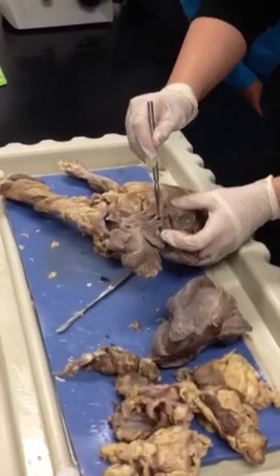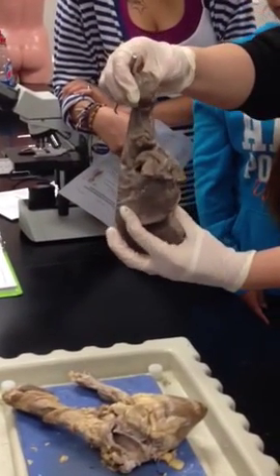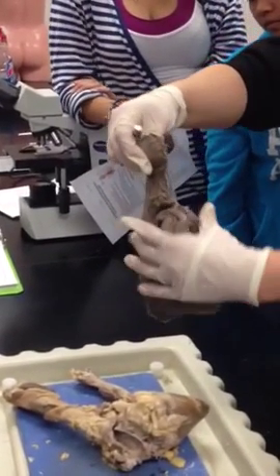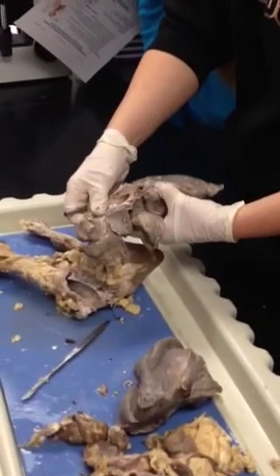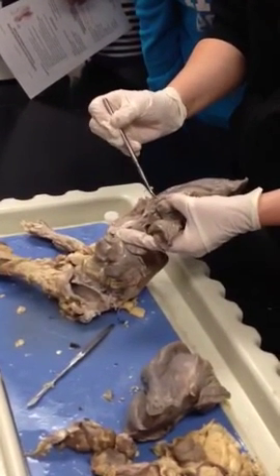So here you can look again. Here's the smaller lobe. Superior, middle, inferior lobe. You guys might want to get gloves on and play with these so that you can tell the difference. I'm just going to let you know that now. This is your primary bronchi. When we're talking about the pulmonary artery and vein, this is your artery. It's thicker. This is your vein. It's very flimsy and thin.